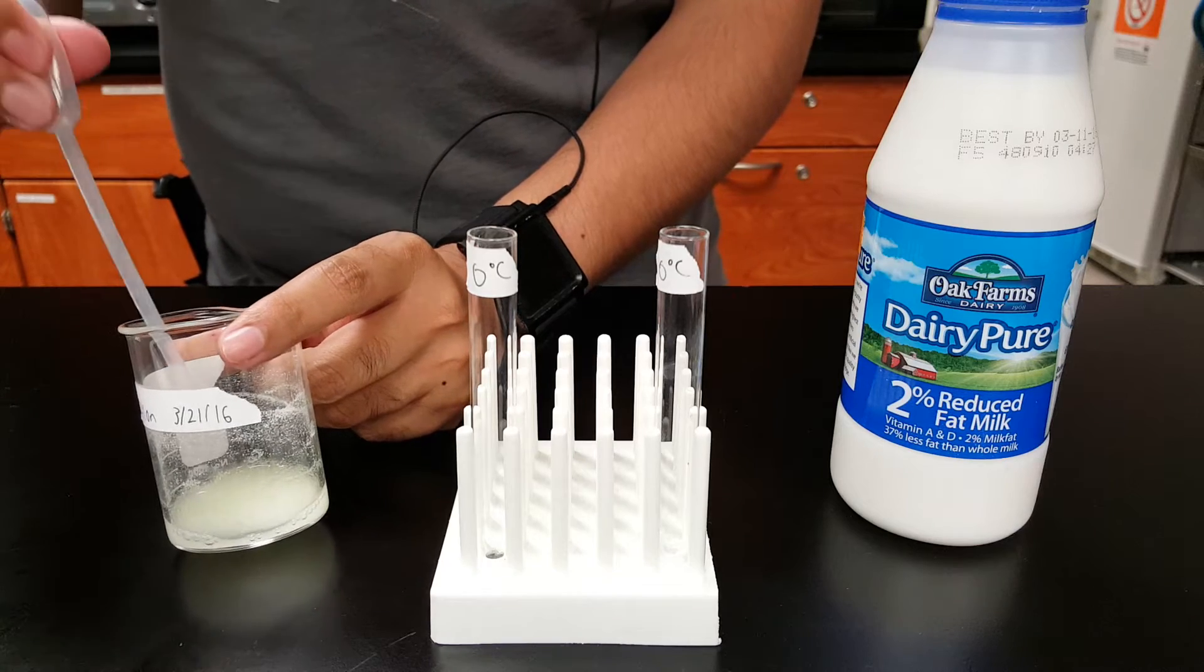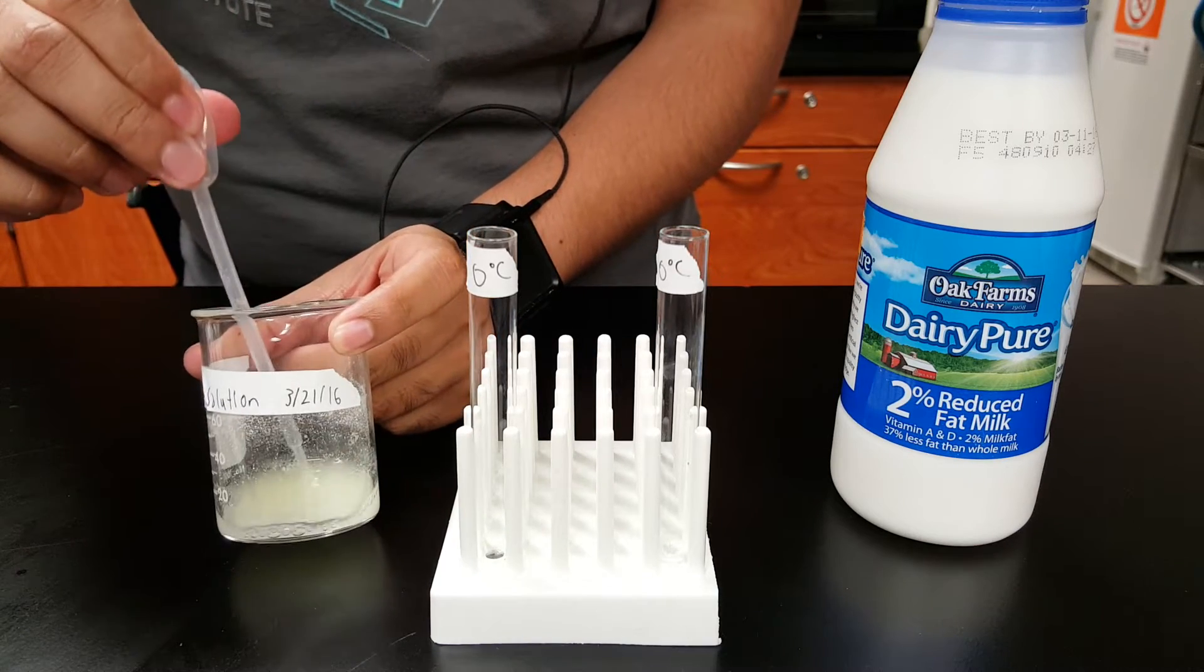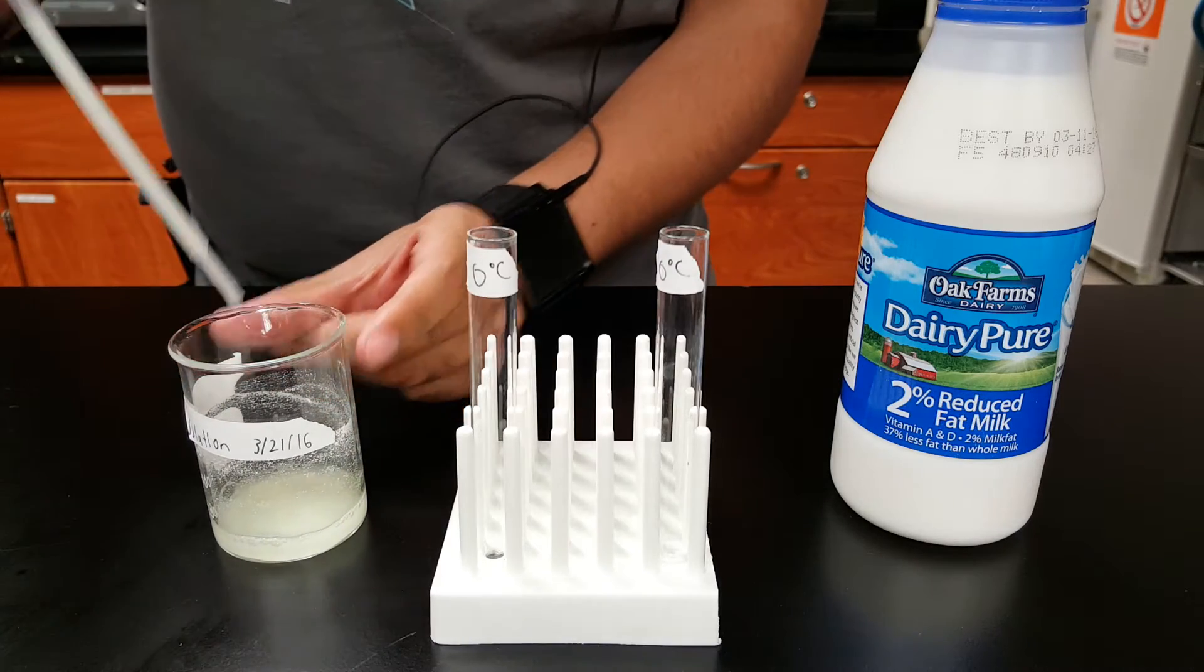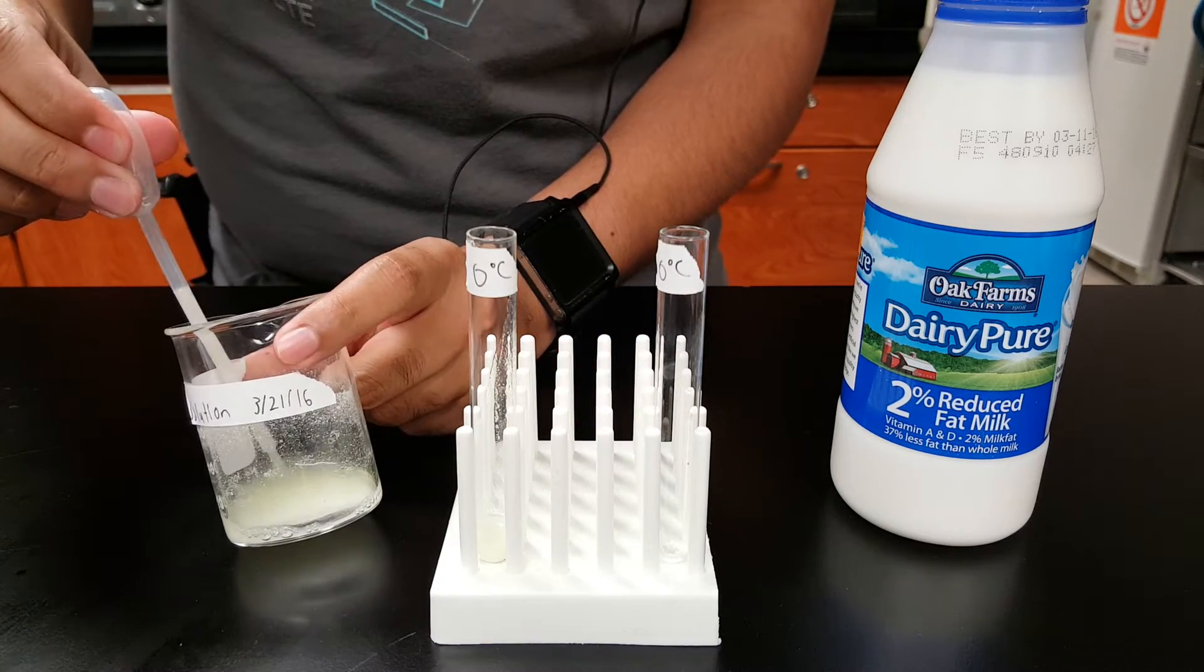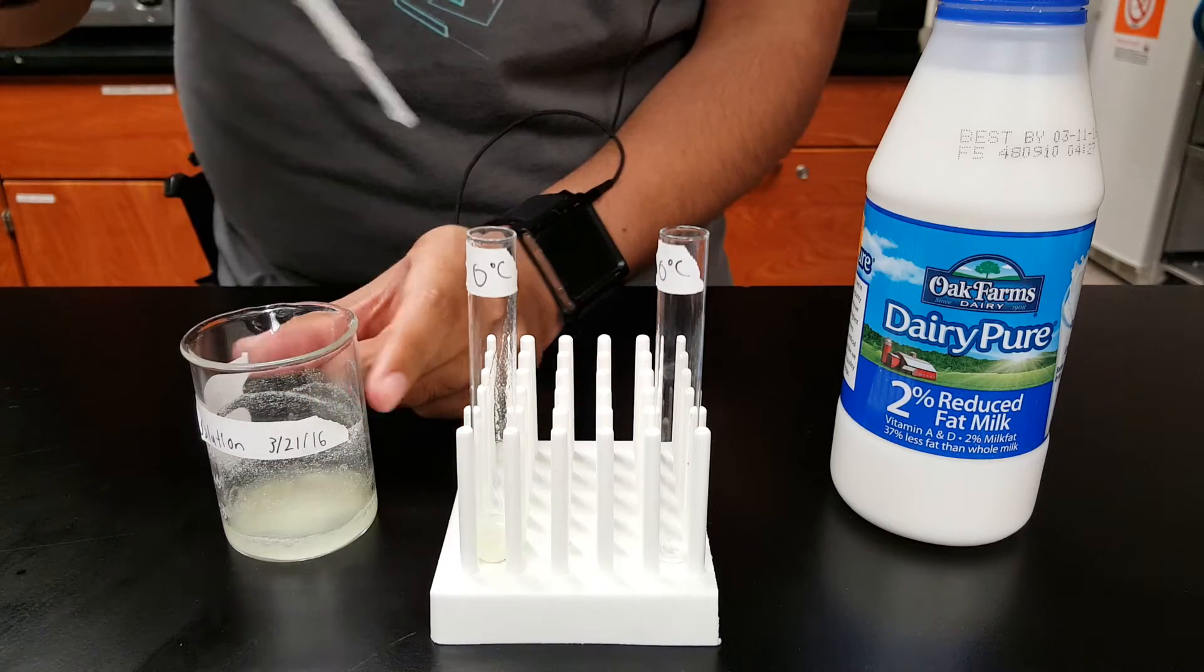First, you take the lactase solution and put two milliliters inside the test tube, just like that.